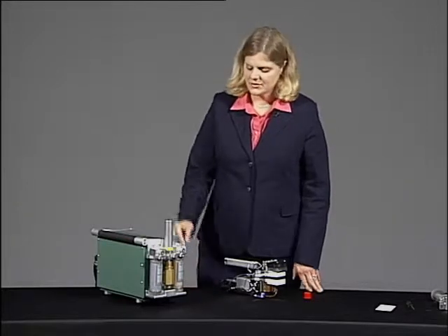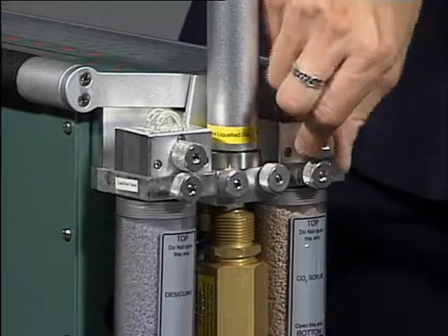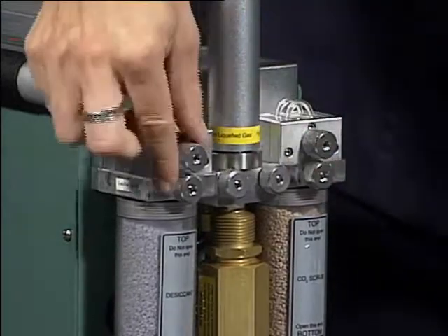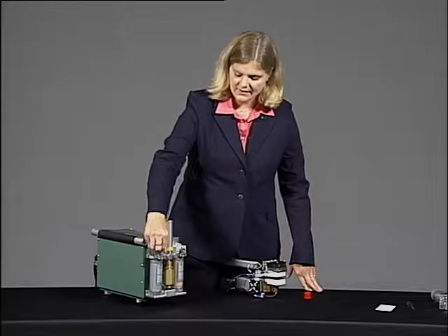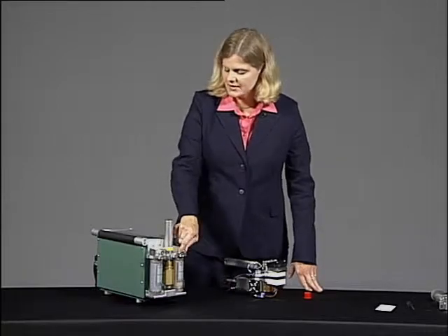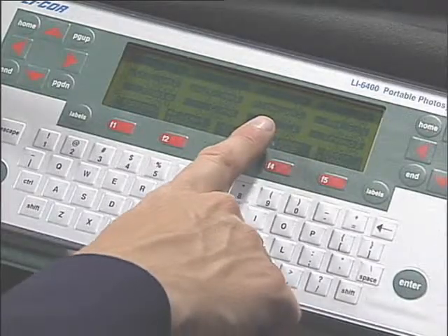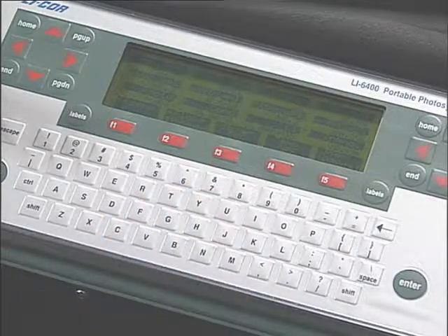What we want to do is start with your chemical tubes on the full bypass position. So go ahead and move the knurled nut on the top of the chemical tubes until they're finger tight in the bypass direction. And then I want you to take a look at menu level B. The third parameter is flow rate, and make sure that that's at least above 650.